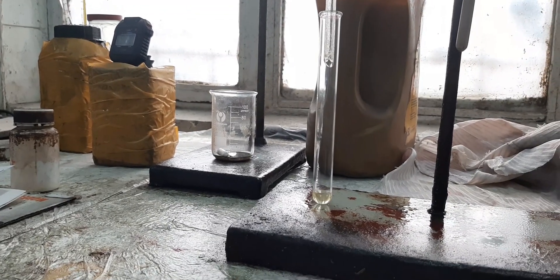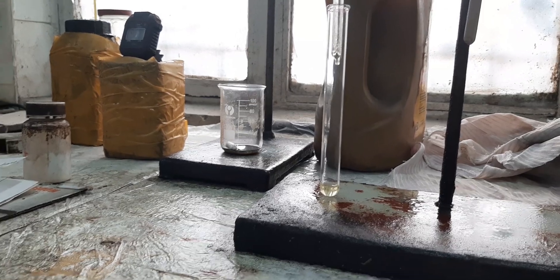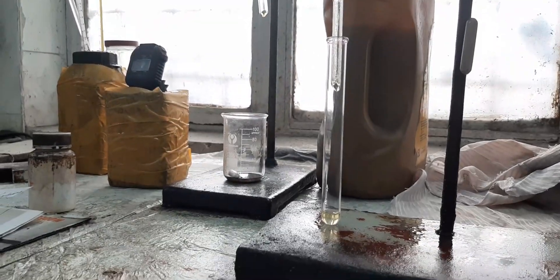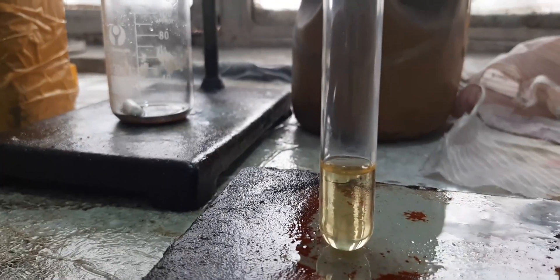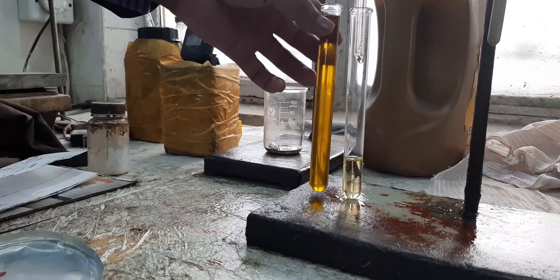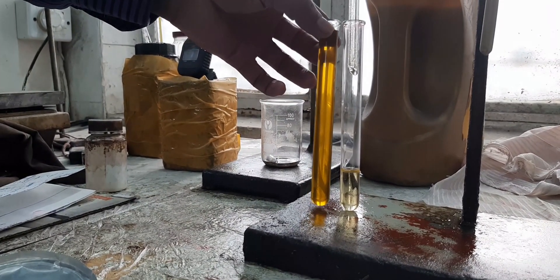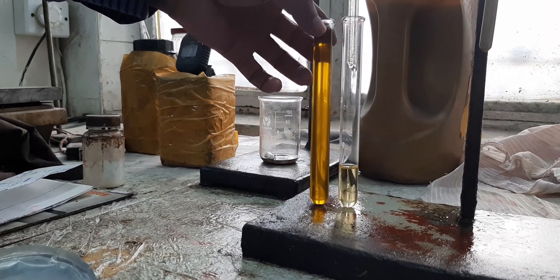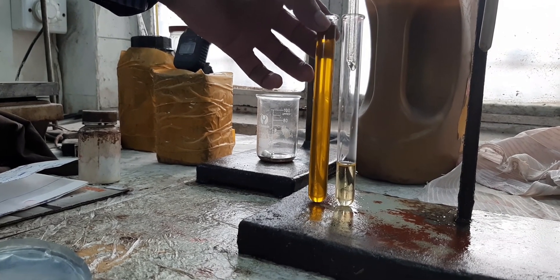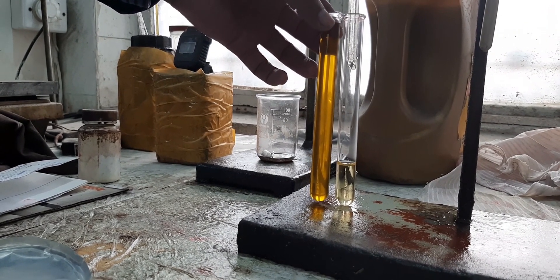See — clear droplets of oil are dripping. Now you can clearly compare the two samples: the one before bleaching and the dripping one after bleaching. You can clearly see the color difference.